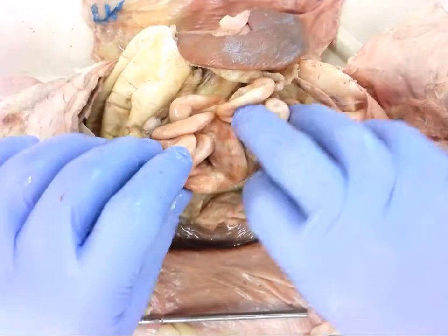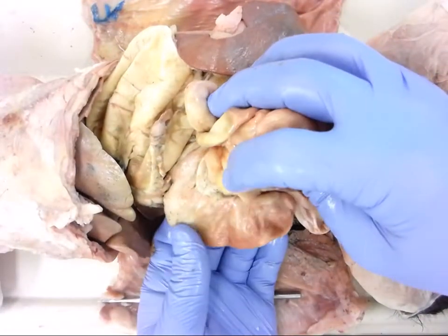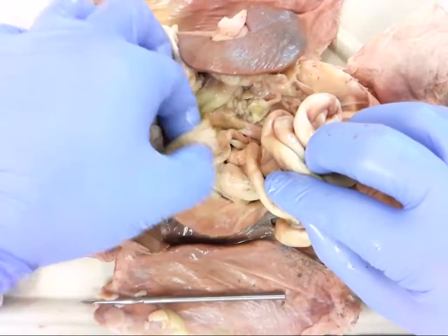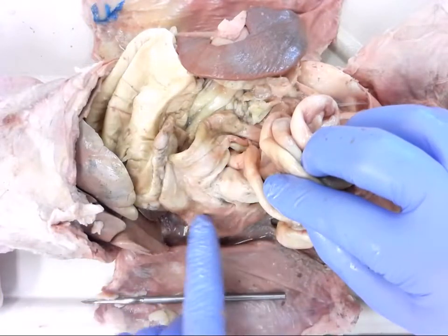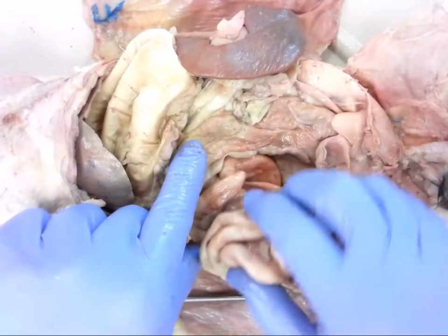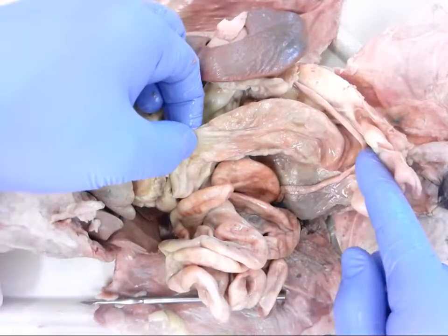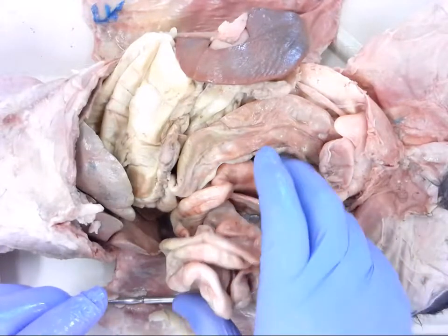After the small intestine snakes through, we enter the large intestine, which has three sections. We have the ascending colon coming up, the transverse colon going across — on this specimen it's fairly short, though on others you'll see it come up, go across, and then back down. Then working over to the other side is the descending colon, which takes the remaining waste product down to the rectum and anus for removal. And that is your digestive tract.